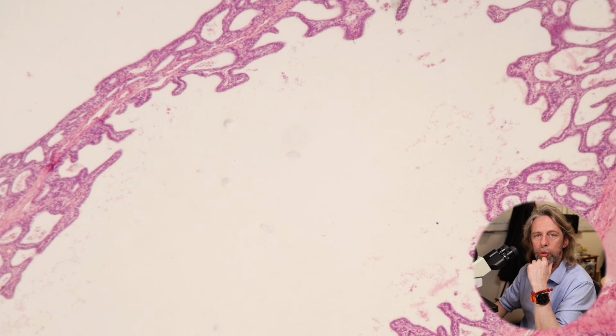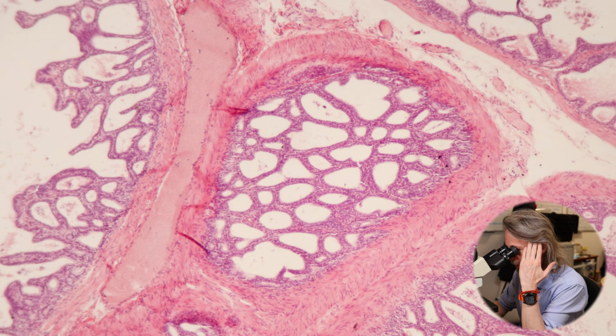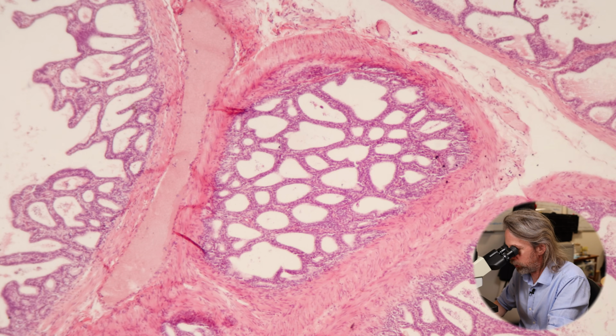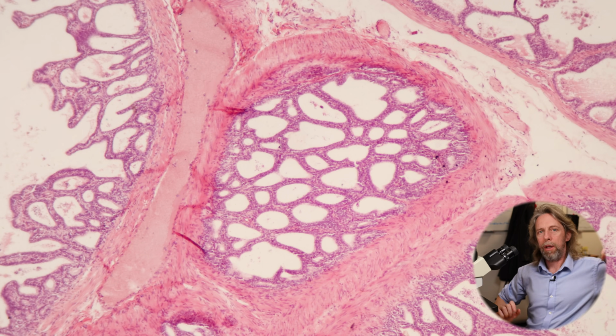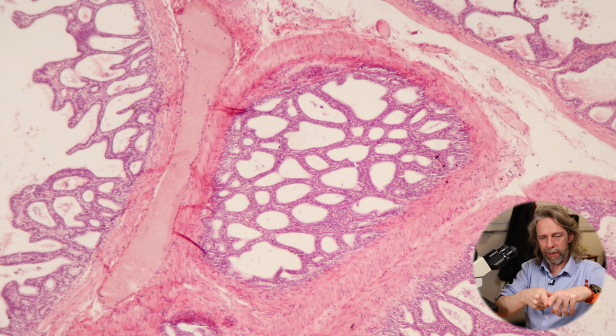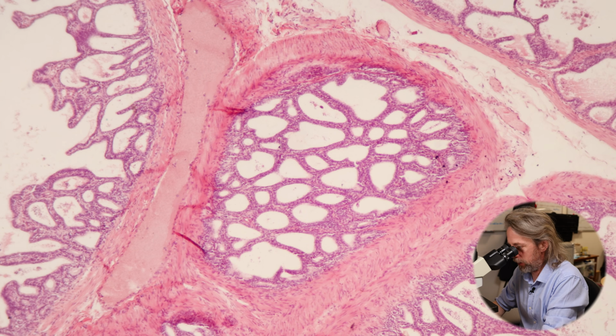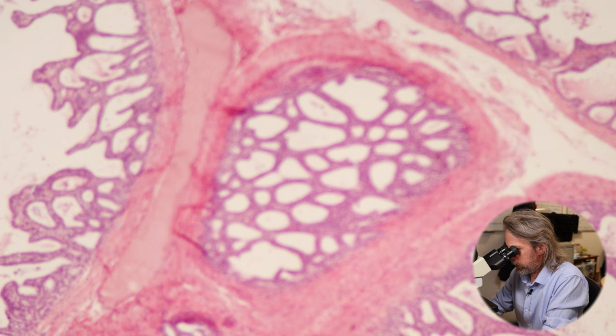There we go. So I think that other tube that we saw on the prostate slide, I said, oh, I think I know what that is. I think that is a duct from the seminal vesicle, because anatomically, of course, you've got the ejaculatory duct, you've got the seminal vesicles duct right nearby. They're going to duct into the urethra. I've no idea what the plane of section was in that section, but do you see how it looks a bit similar to these? This is quite striking, isn't it?